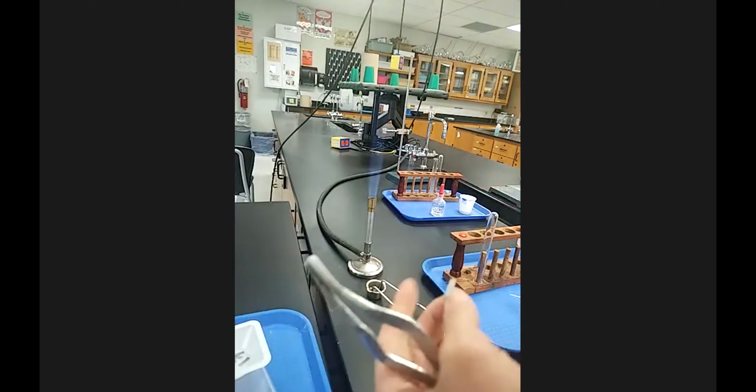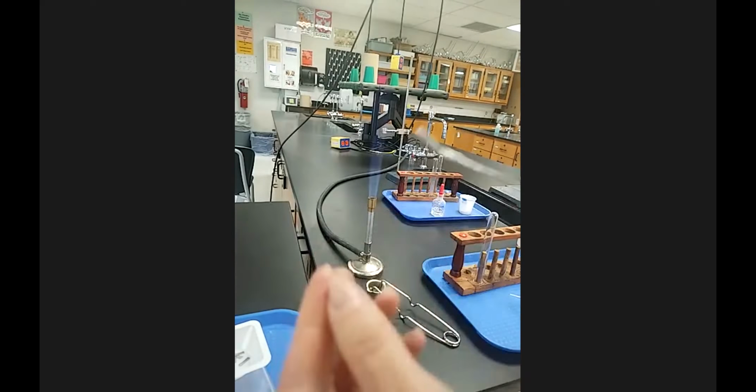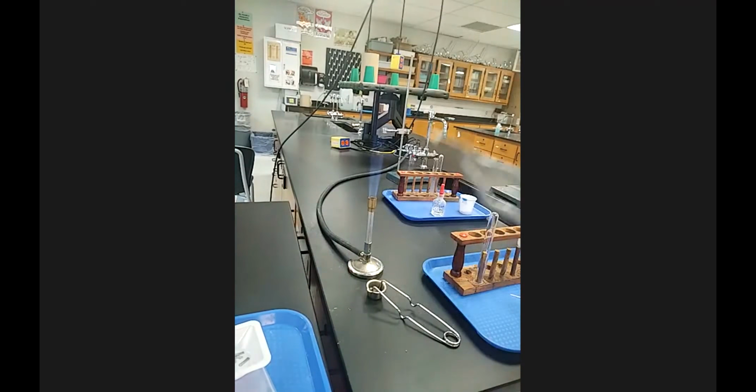Now, if you're in person, it does say don't look at the magnesium piece directly, and that's good advice. It's going to be very bright. I don't know how it will translate over the screen, you're probably going to look at it directly anyway, but a good technique, if something says don't look at it directly, is you stand, like I'd be standing here looking forward, but I'd see it out of my periphery. Like I'm staring at my chair and I can see the Bunsen burner, and that would be a good lab technique.